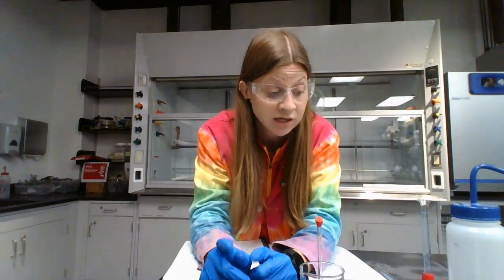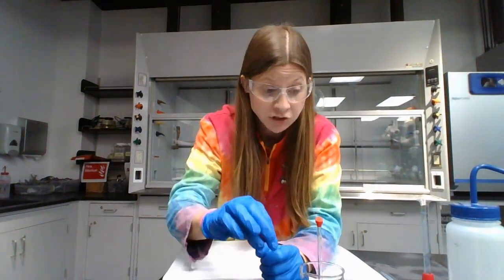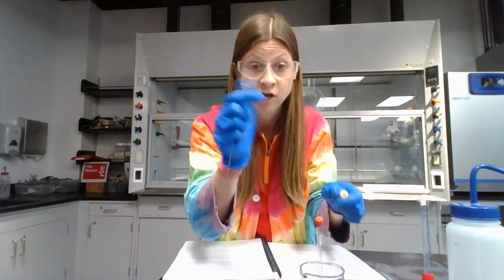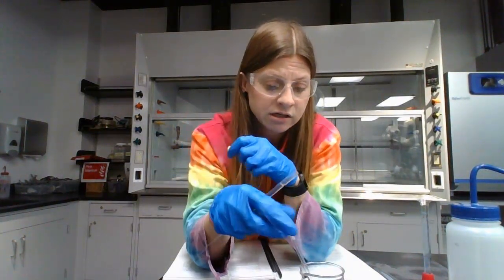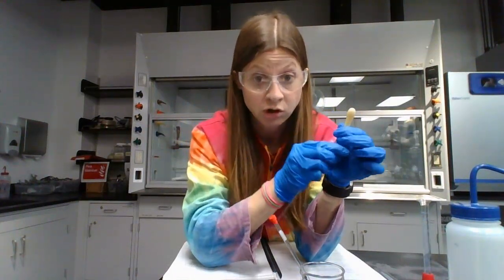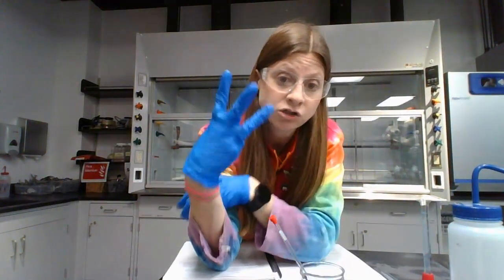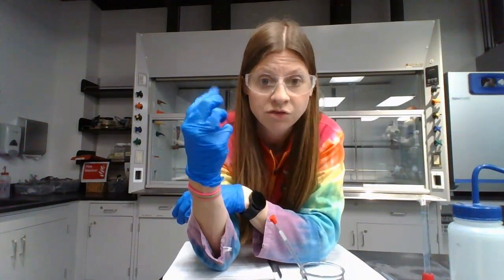One is to transfer your Pedialyte or chicken broth into an NMR tube. So to do that, you're just going to pour the Pedialyte or chicken broth into a beaker, get a fresh Pasteur pipette, a fresh NMR tube, measure 4 centimeters from the bottom on the NMR tube, and transfer the chicken broth or Pedialyte directly into the NMR tube. Okay. So you'll do that for your chicken broth or your Pedialyte.